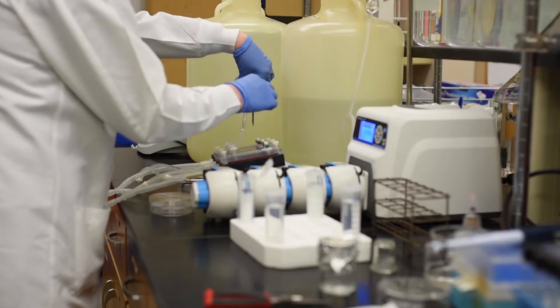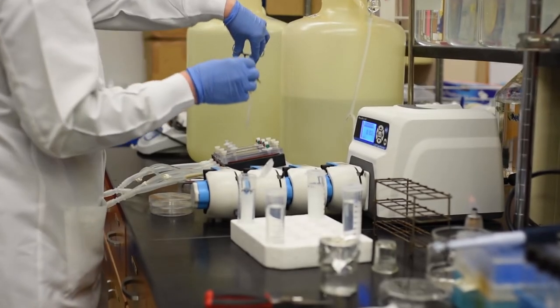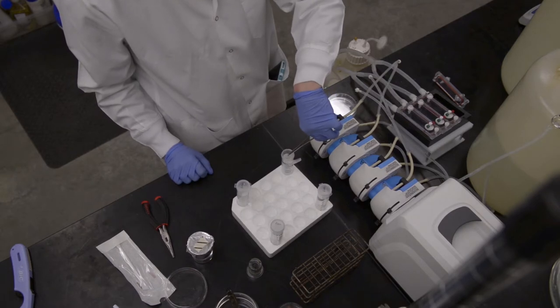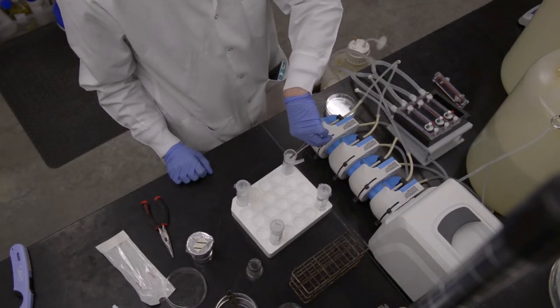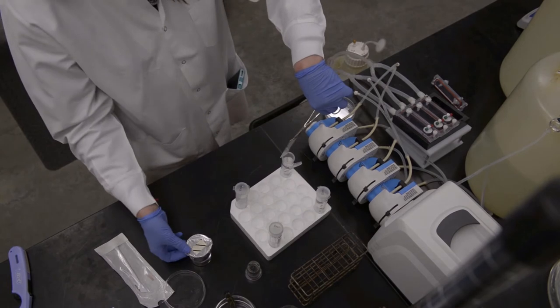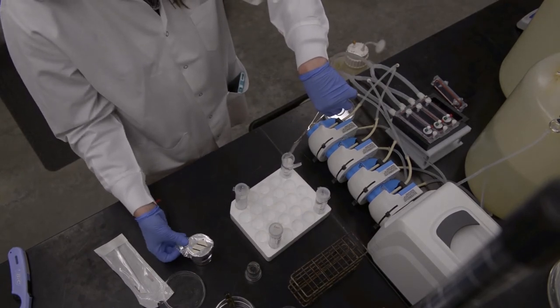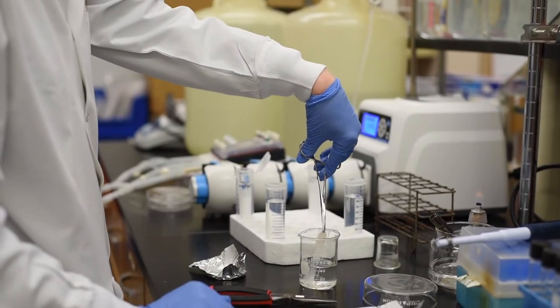Grasp the edge of the slide with the hemostat and gently remove it from the channel. Rinse loosely attached cells by gently dipping the slide into 45 milliliter sterile buffered dilution water in a 50 milliliter conical vial.